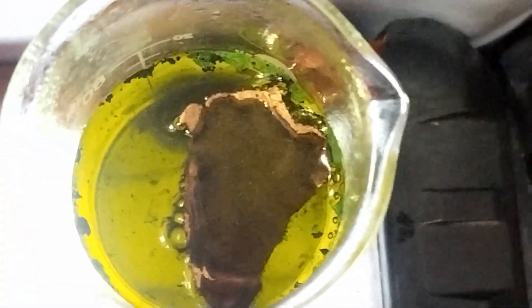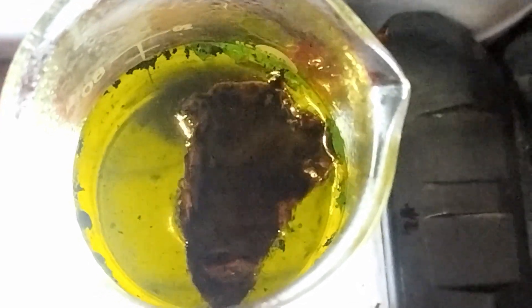This slightly yellow solution is aqua regia. And this is how it reacts. Watch closely as the copper foil dissolves, releasing fumes and forming a completely new solution.